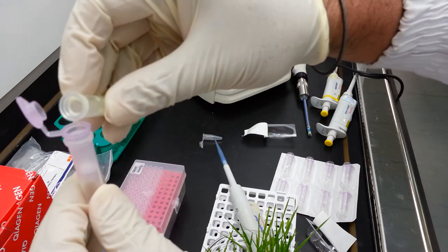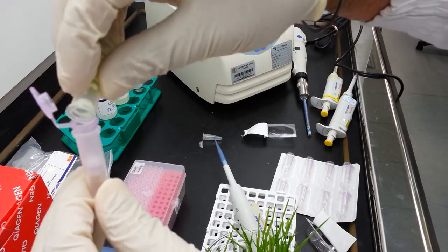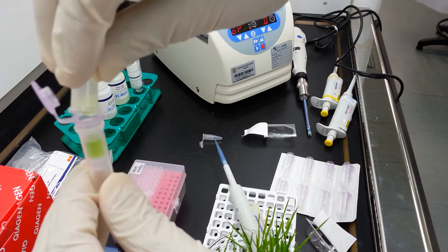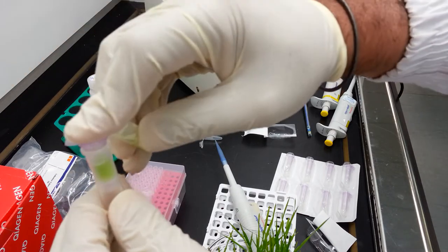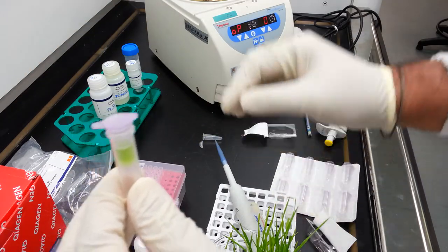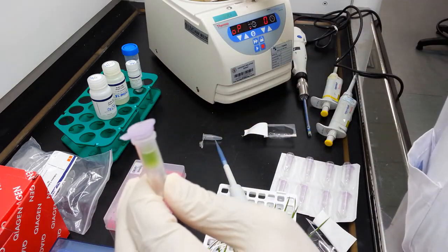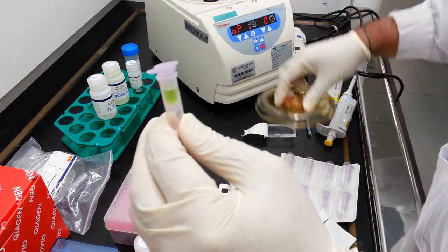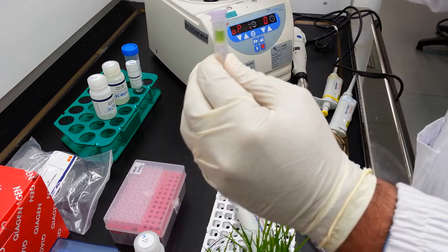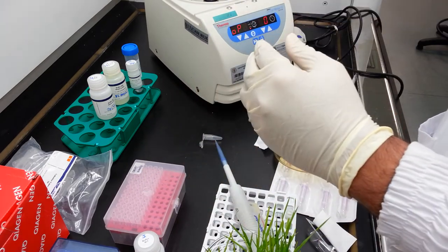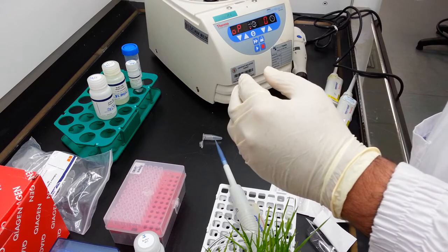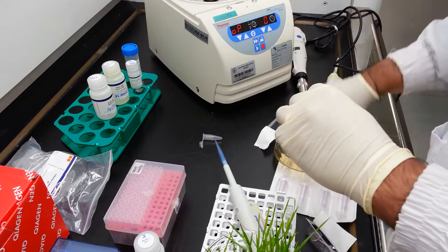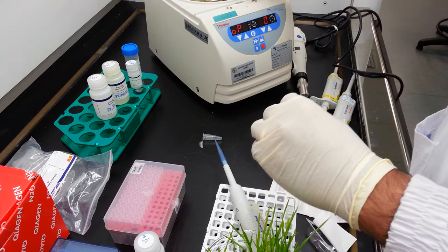The upper section which is purple and contains the cartridge, and the lower section which is essentially a collection tube. Transfer this lysate into the upper column and we now can proceed to centrifugation. I have set this centrifuge to 12,000 G for one minute.